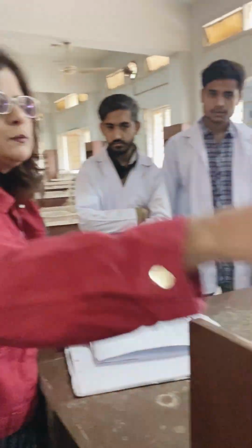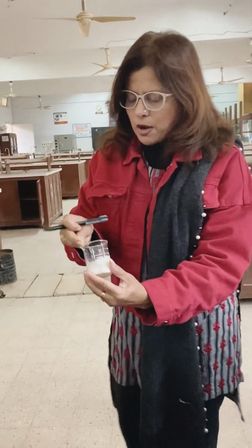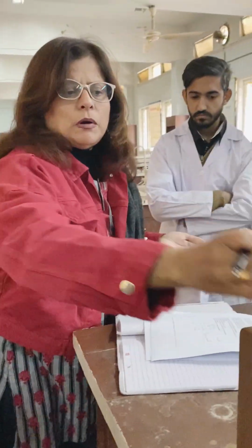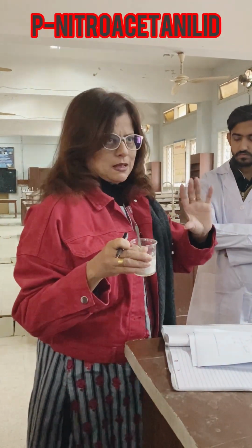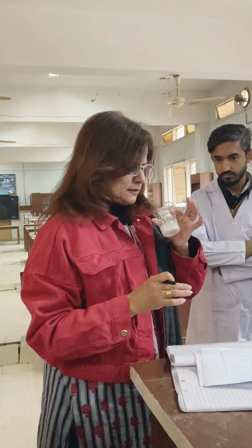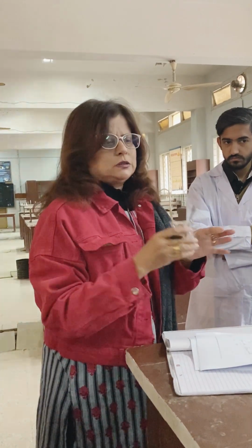I think it's lying here. This is para-nitroacetanilide. Just see, it's a white powder. You can see only its appearance, and it doesn't have thicker granules. It's just in a powder form, right? We know the name, that is para-nitroacetanilide. That means the nitro group is attached at the para position on this compound. So this is what we know up till now, and we know the color. Let's smell it. It has almost no smell, no odor.